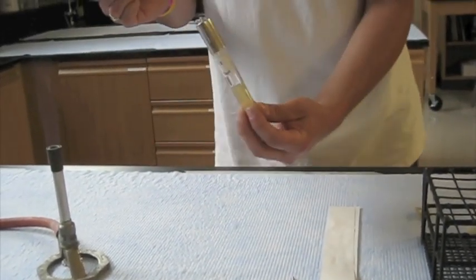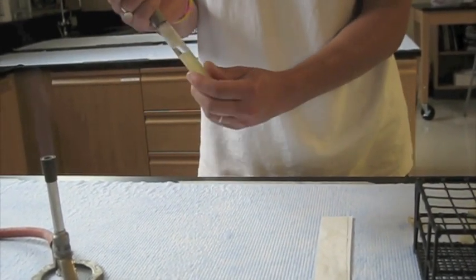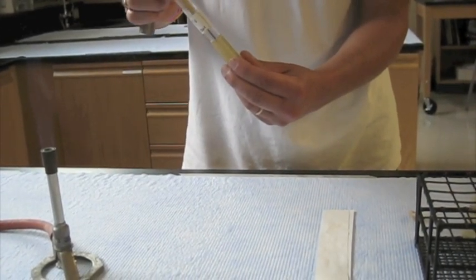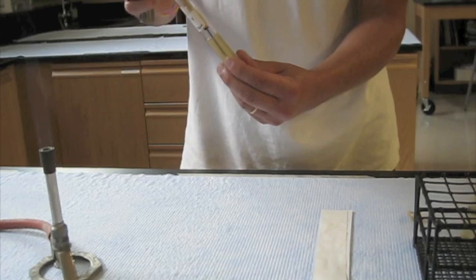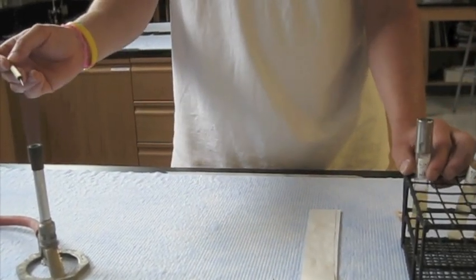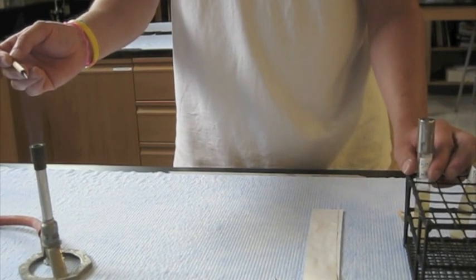Take my tube, again making sure to flame open and flame closed. Flame open, and now I'm just going to go straight down into the gel and pull it straight out. Flame closed, sterilize my instrument, and we're done.